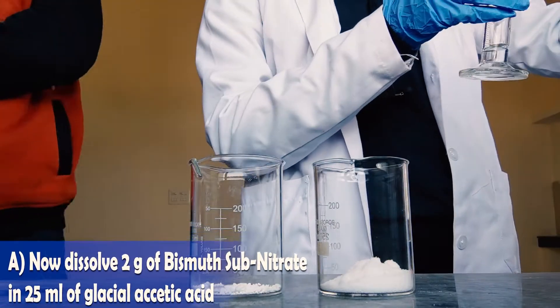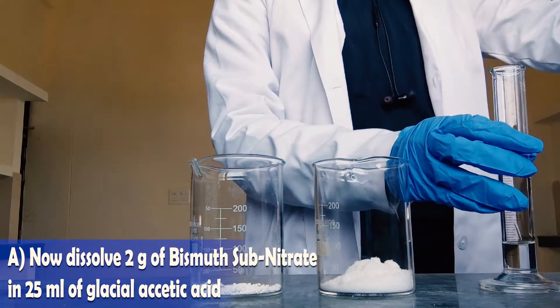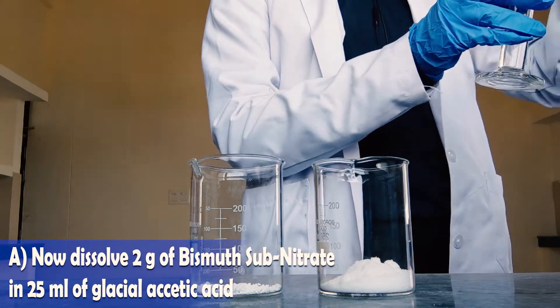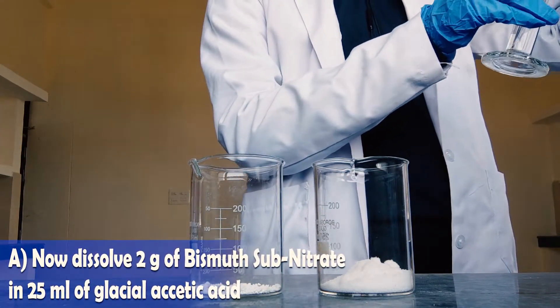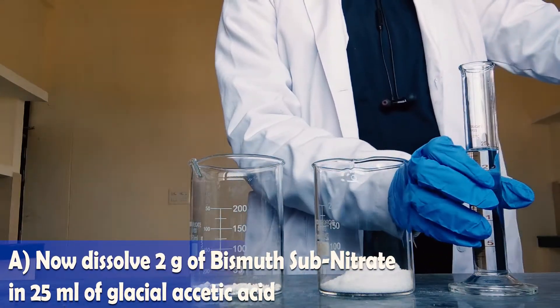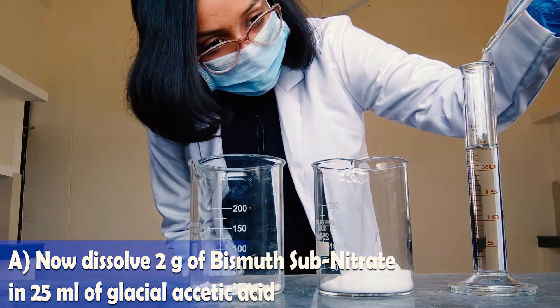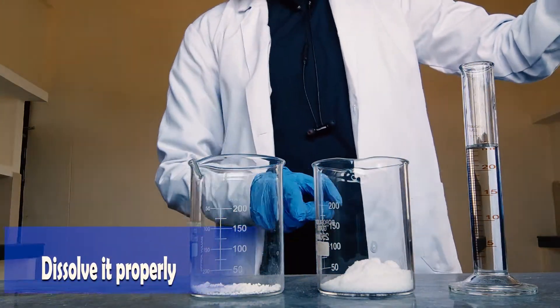Keep both the measured chemicals in separate beakers. Dissolve 2 grams of bismuth sub nitrate in 25 ml of glacial acetic acid. For that, first of all measure 25 ml of glacial acetic acid in the measuring cylinder, then add it to the 2 grams of bismuth sub nitrate. Dissolve it properly.